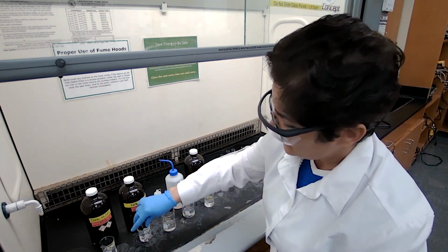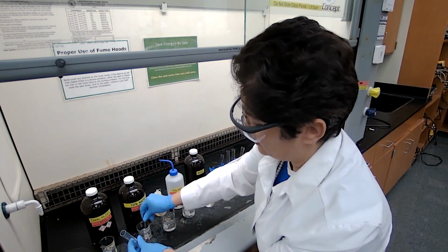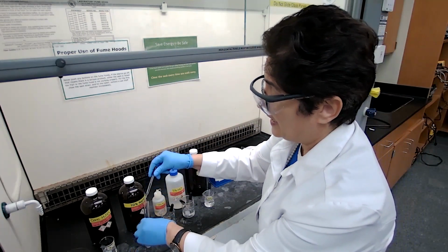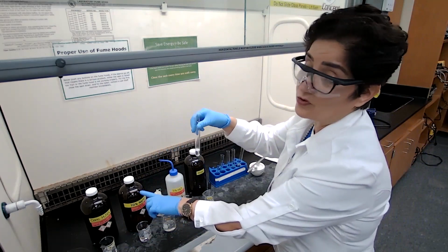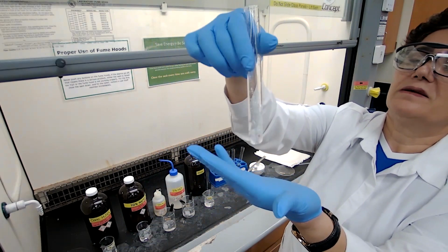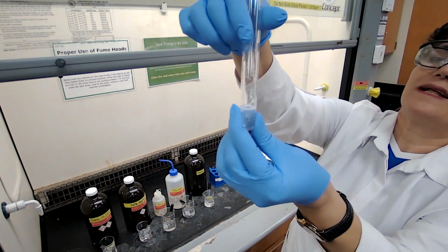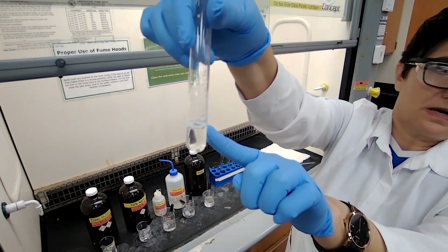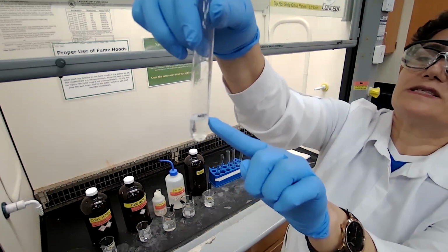So we're going to check with the sodium hydroxide. Since it already dissolved in sodium hydroxide, I'm testing with sodium bicarbonate. If it doesn't dissolve in sodium hydroxide, I do not test for sodium bicarbonate. Okay, sample, so I shake it. Okay. It's not disappearing, but I noticed that there are some bubbles forming at the surface of this mixture. If I wait long enough, I could see the bubbles are forming.